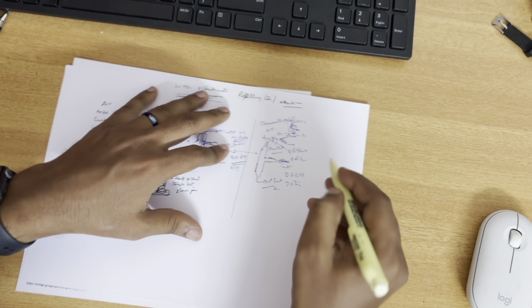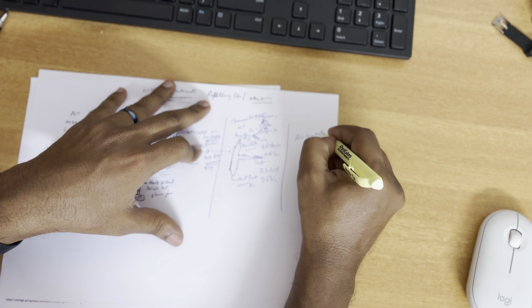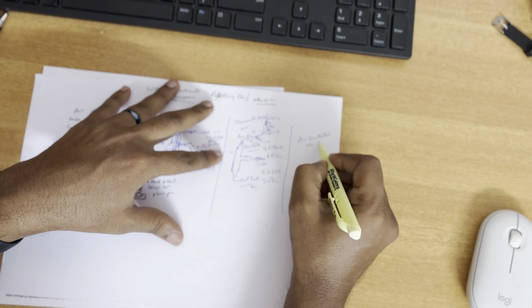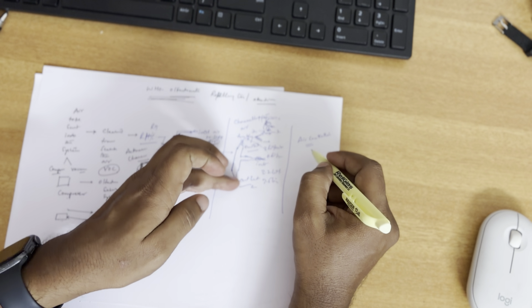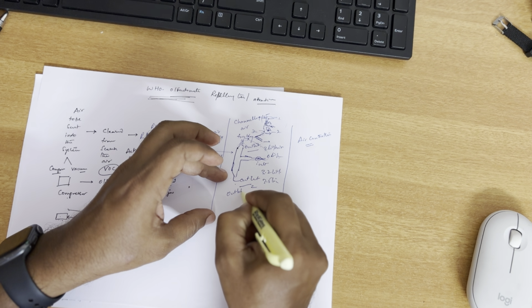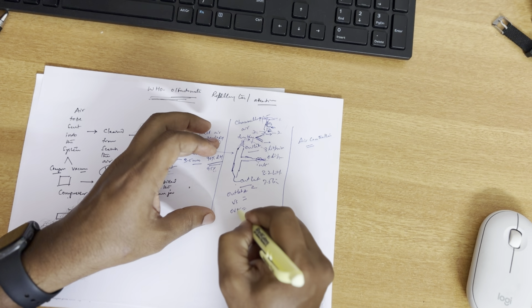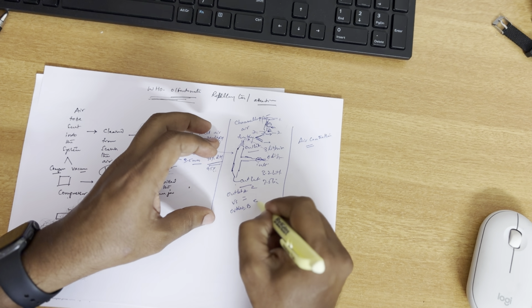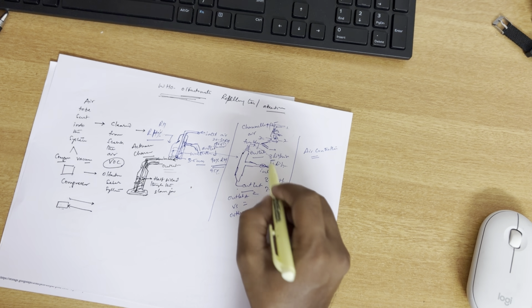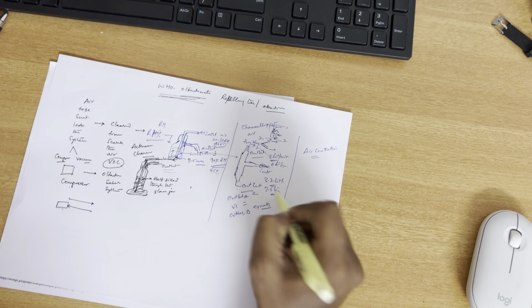So now you have to neutralize this using the air controllers. What will happen when you send the air through the controller is that you're going to set it so that the amount of air coming from outlet A versus outlet B will be exactly equal. It means that the air coming out from outlet A, say for example, was 3 liters per minute, and outlet B is 3.5 liters per minute.